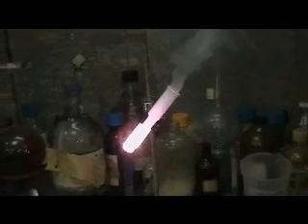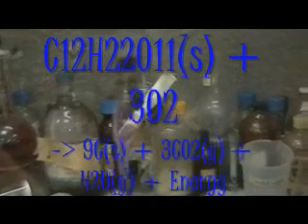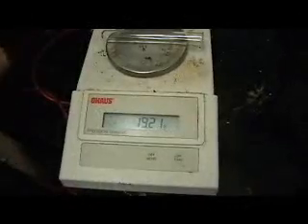After it's melted completely, simply take a gummy bear using tongs and drop it into the solution. A bright flame will ignite, with gases being quickly thrown out from the test tube. What is happening is that the sugar from the gummy bear is reacting with the O2 gas being produced, which is known as combustion.